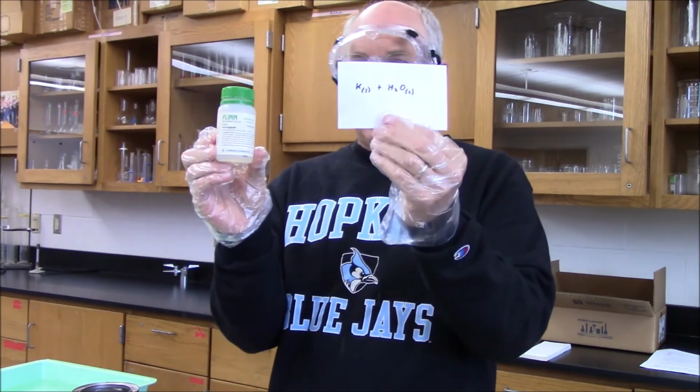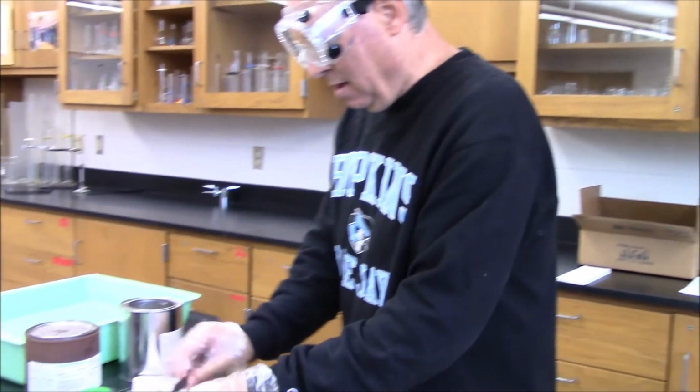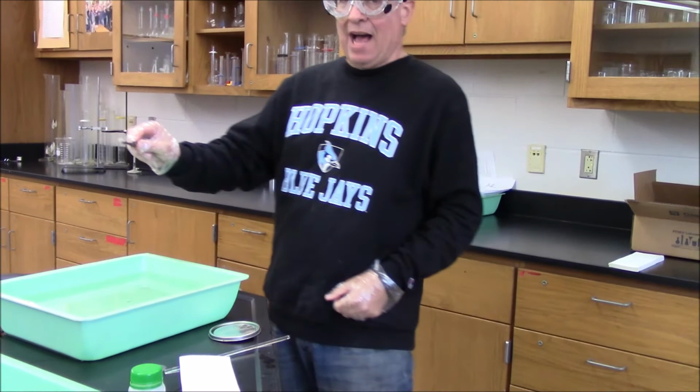Oh, potassium in water. Potassium also comes pre-cut. Here's a little piece of potassium. And let me get all these guys out of the way. Drop it in the water and see what happens.